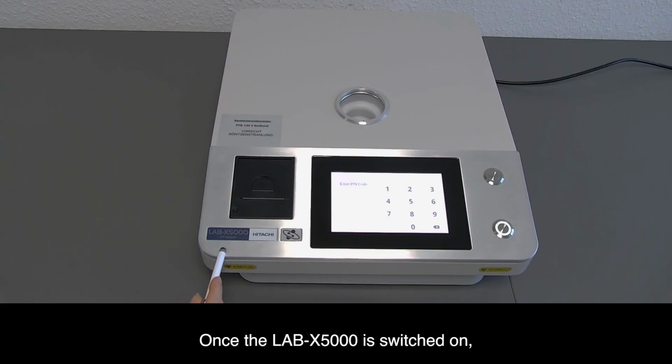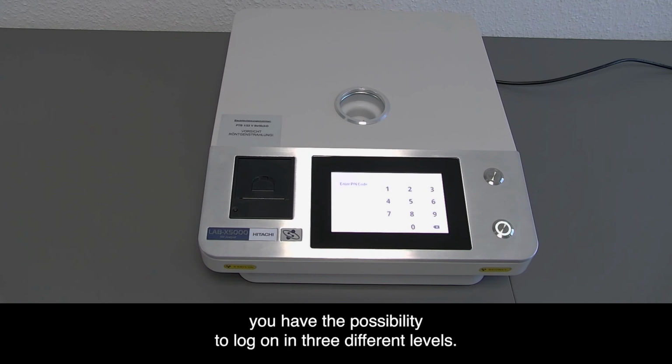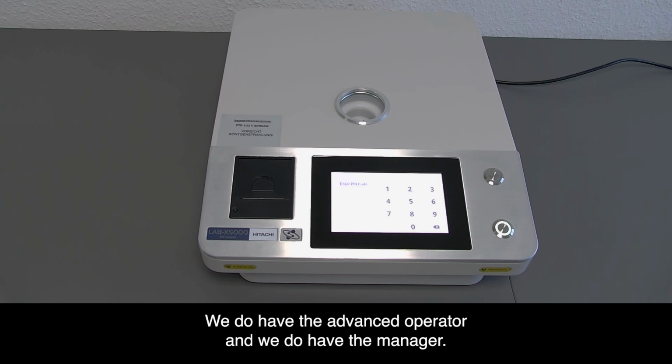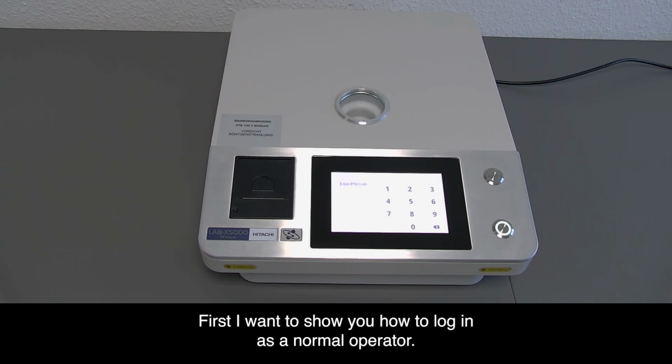Once the LabX5000 is switched on, you have the possibility to log on in 3 different levels. So we have the normal operator level, we do have the advanced operator, and we do have the manager.